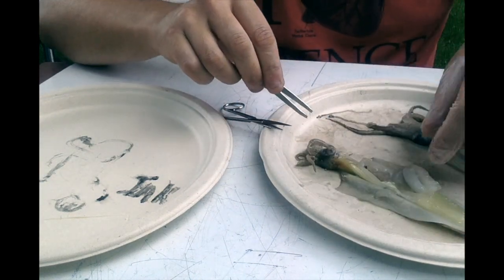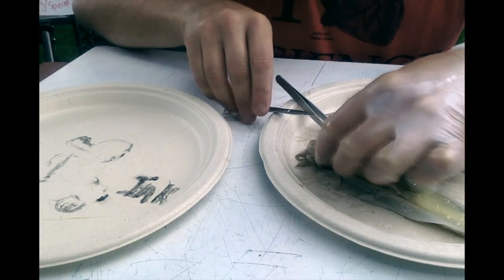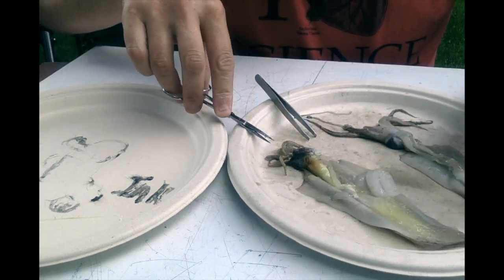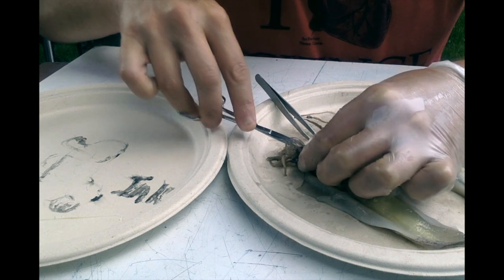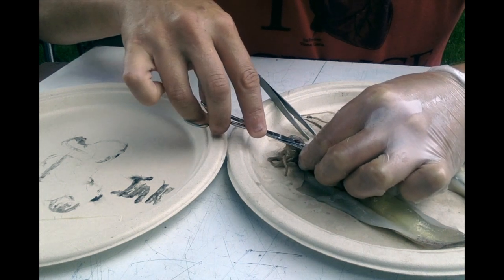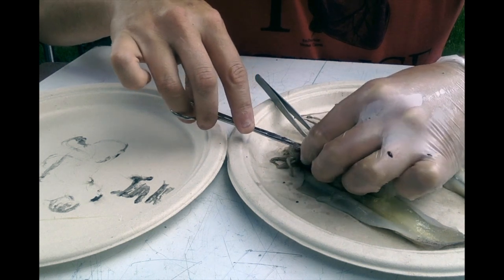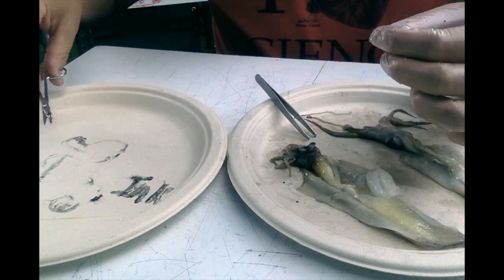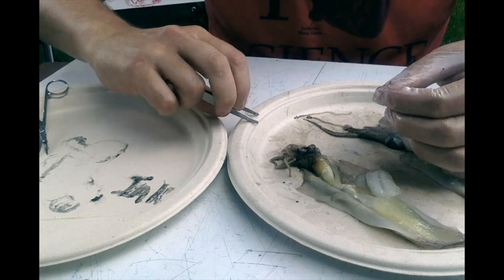Let's take a look and see if we can dig into the eye. This is going to be a lot of fluid, and this is really interesting. By that I mean when students do this in class, they find it to be very gross. But if we cut into the eye here, the eye is a lot like the human eye, and that means, whoa, it squirted out. Had a lot of students get in trouble for doing that in the past. This one was really easy to find. It kind of popped right out.